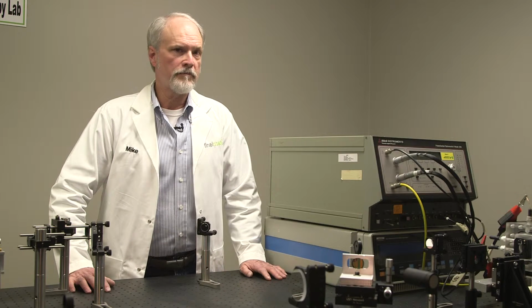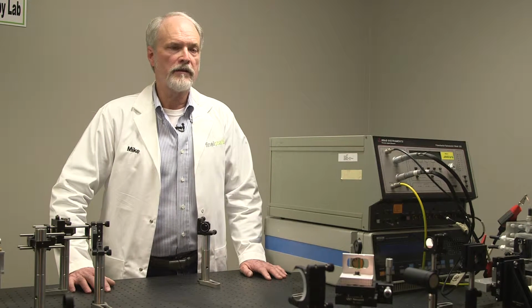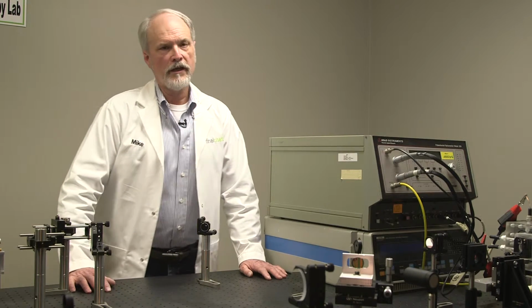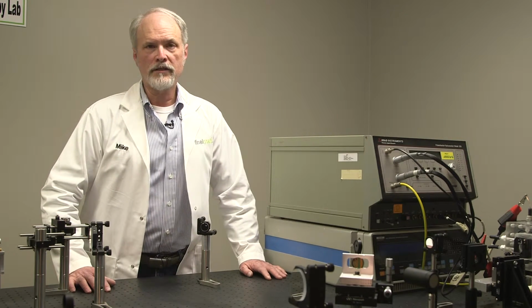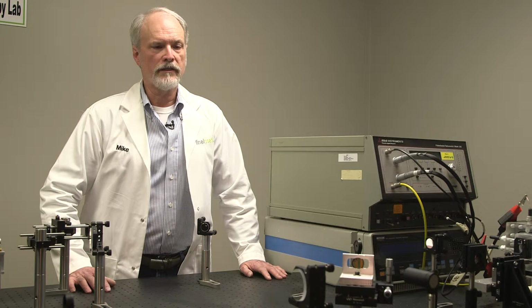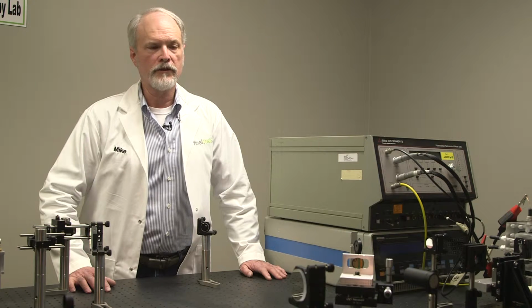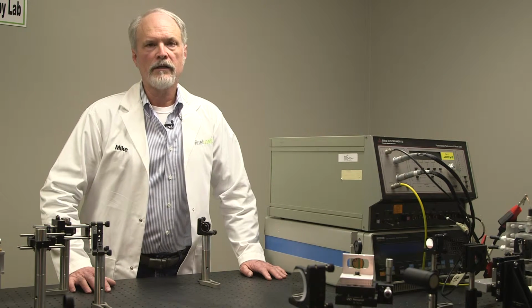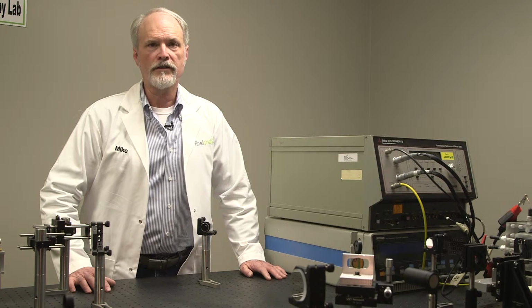And your surface products are not going to be the same any longer. Now, those methods do have a place. However, studying the corrosion process while it's happening in the electrolyte is something that's really, really useful, because you can actually identify with Raman spectroscopy the chemical species that are on that surface.